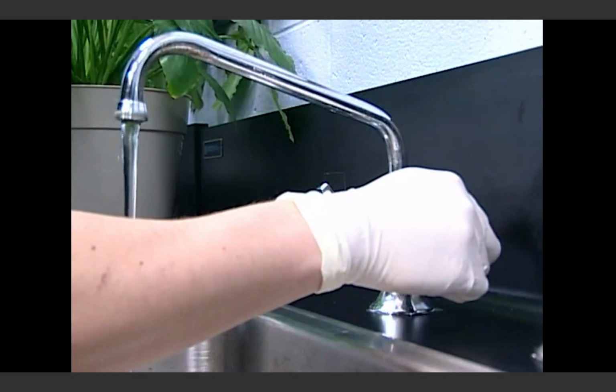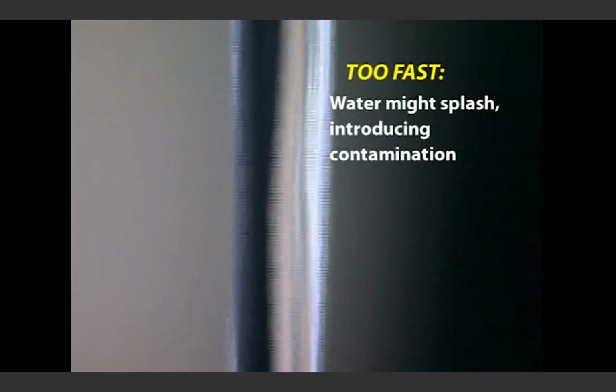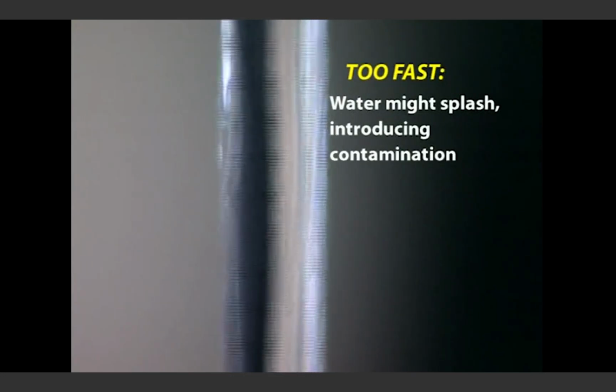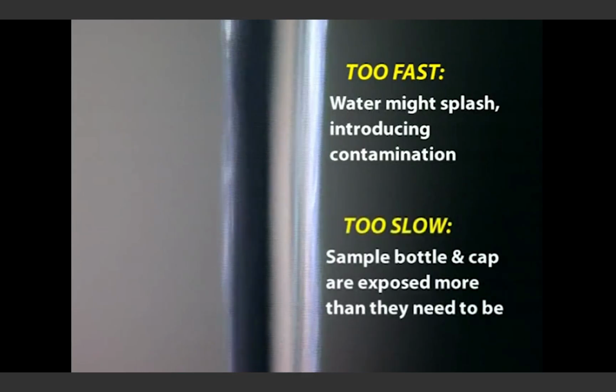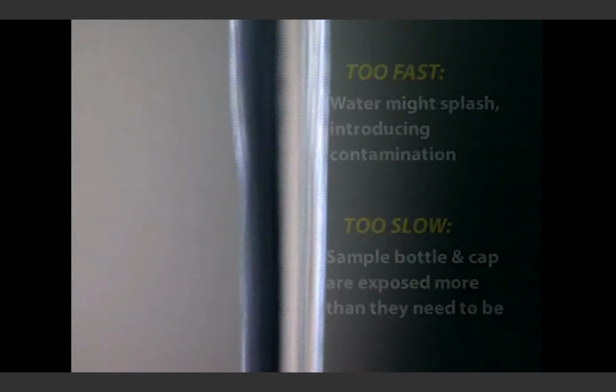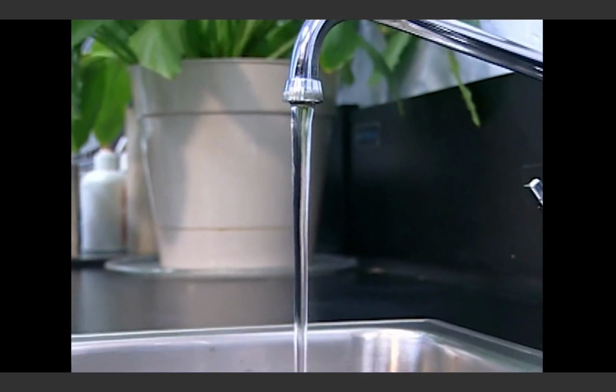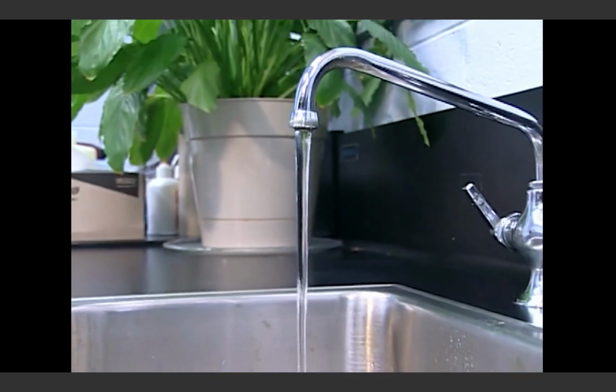Set the flow at a rate that is neither too fast nor too slow. Too fast means that the water might splash and introduce contamination not originally found in the water. Too slow simply means that the sample bottle and cap are exposed to potential contamination more than they need to be. Make sure that the flow is consistent and steady. Do not alter the flow once you've begun the process, as it might dislodge biofilm or scale in the line.